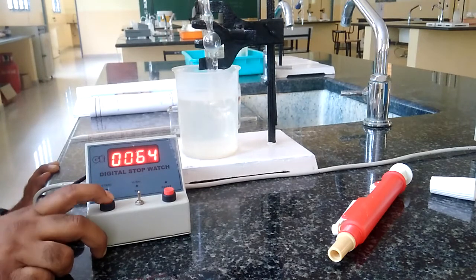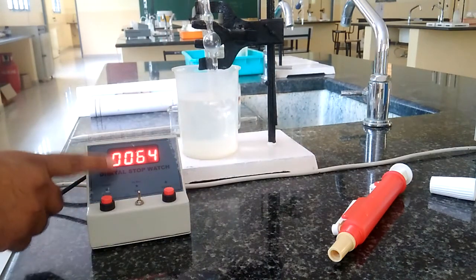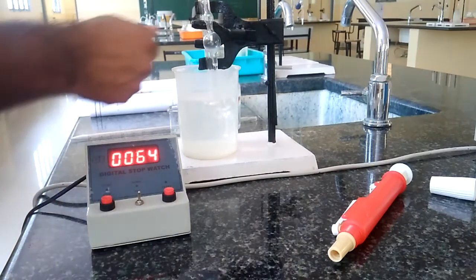It reaches the lower mark and I am stopping. Yes, so it took 64 seconds to flow from upper mark to lower mark.